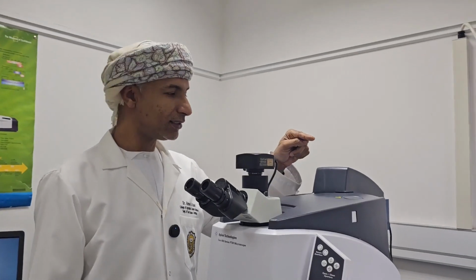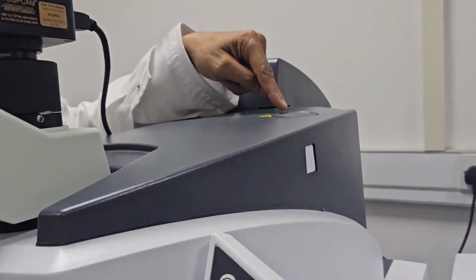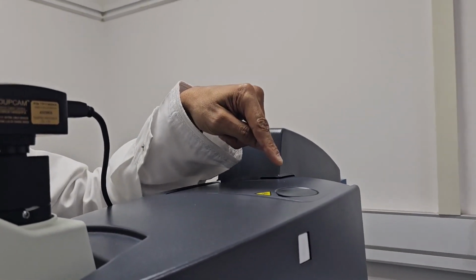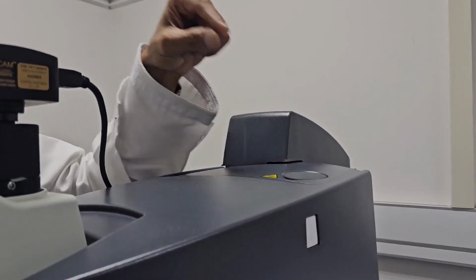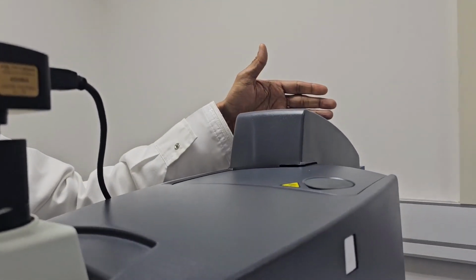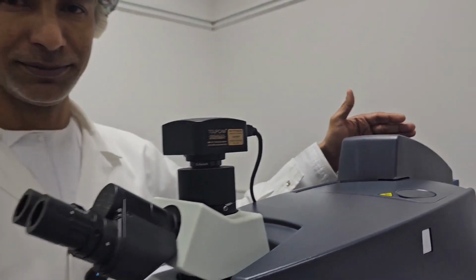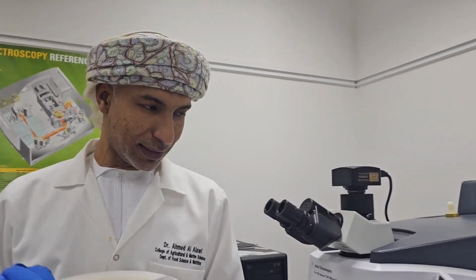For this particular microscope, we also have two detectors: a single point detector and a focal plane array detector. The single point detector we use only for one point. However, the focal plane array detector we use when we would like to examine large areas. Since we are looking at a very small area, we need to reduce the noise as much as possible, and for that we need to cool our detector to minus 200 degrees using liquid nitrogen.